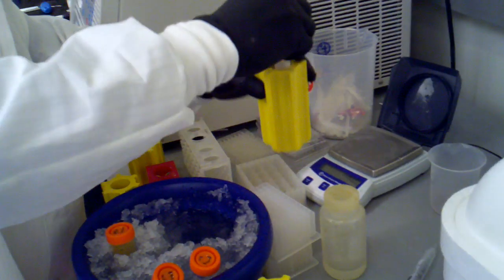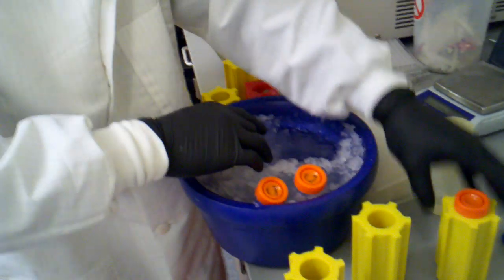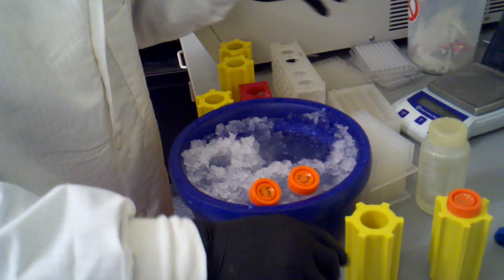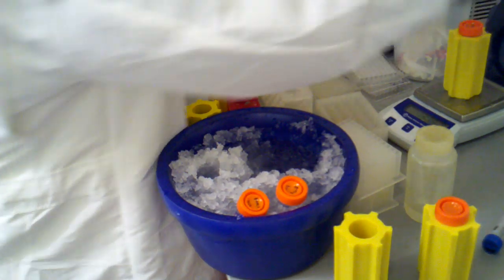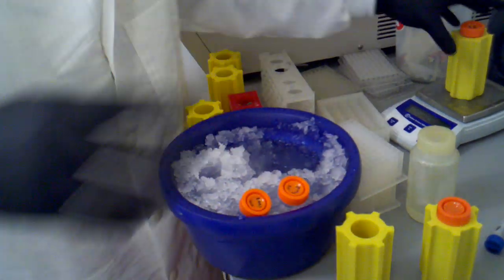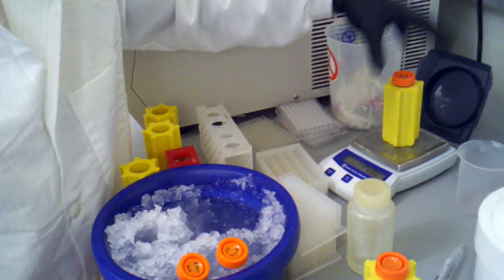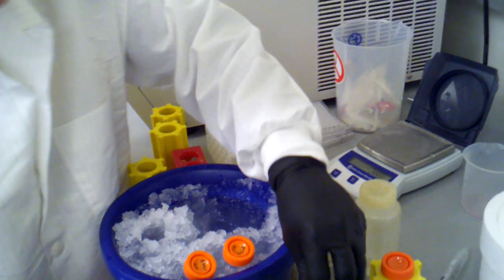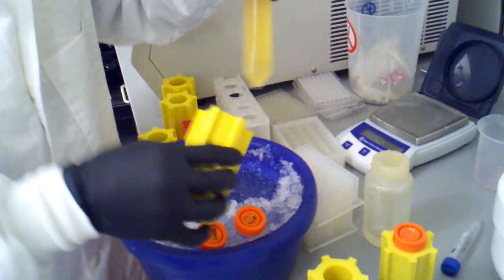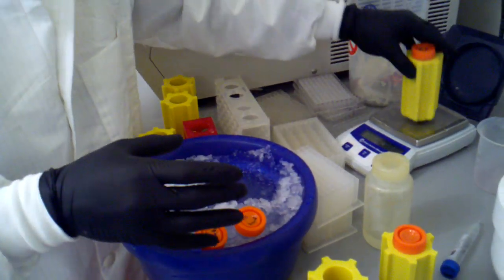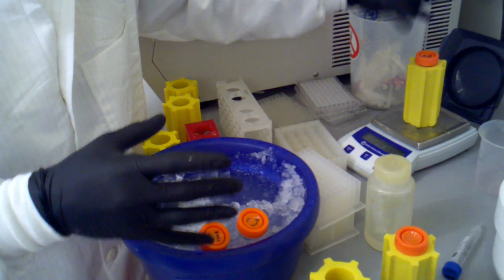Every now and again you get lucky. So I'm now going to double check our actual cells one more time. 206.1. Maybe we'll use this one. 205.1. There we go.